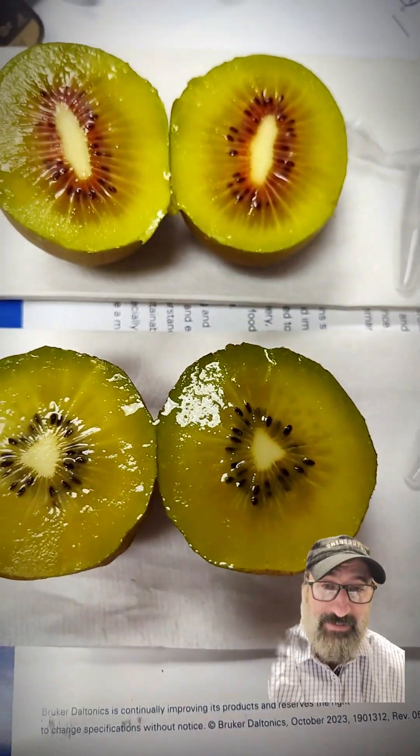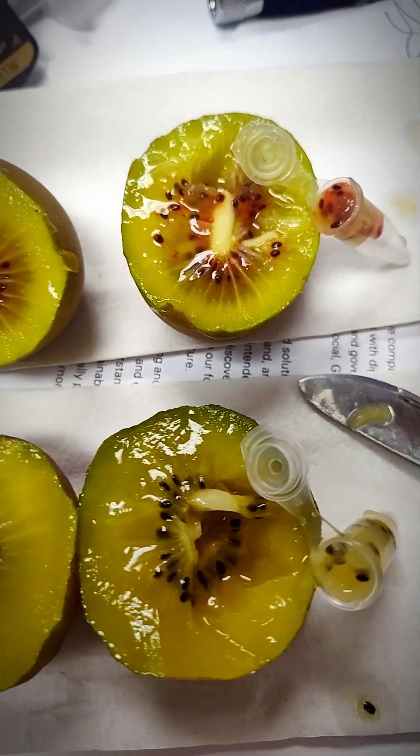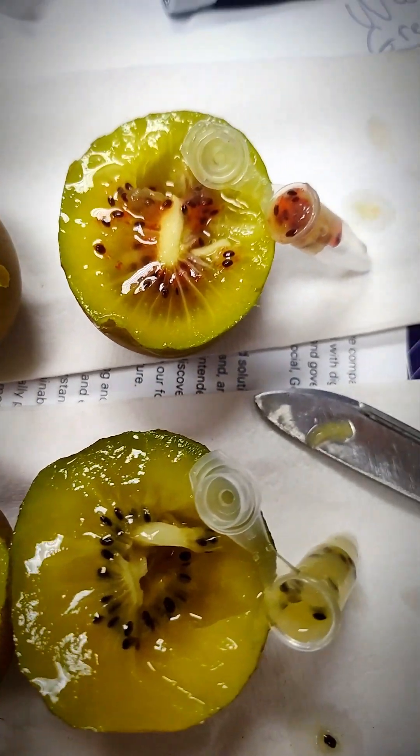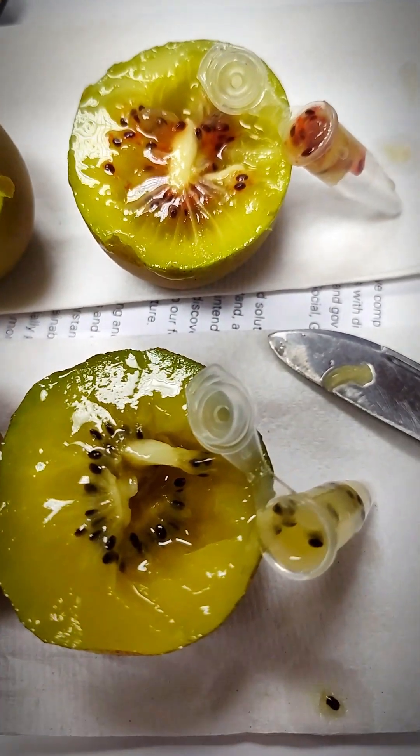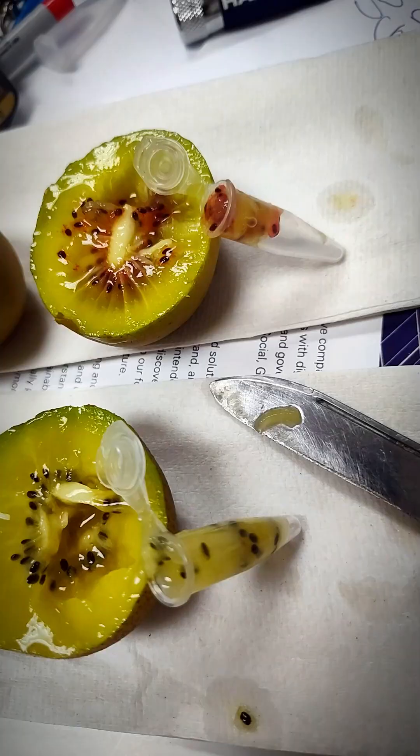Let's see what the red is. That's what I'm thinking. Shove some of the red seed area into that tube and some of the regular green-yellow area, and there we go. We got them in the tube.